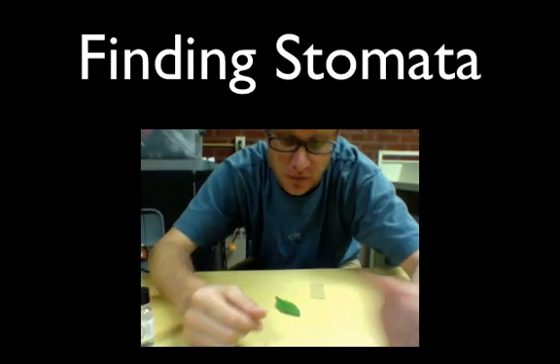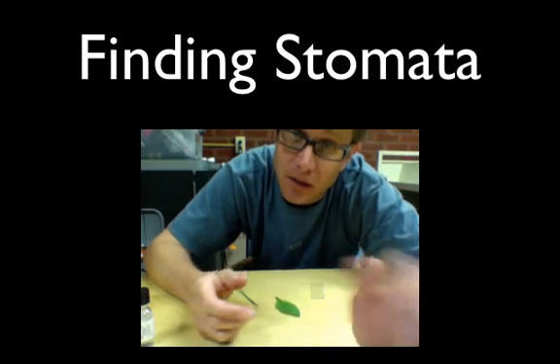Hi. It's Mr. Andersen. And I'm going to show you how to find the stomata in a leaf and look at them underneath the microscope.